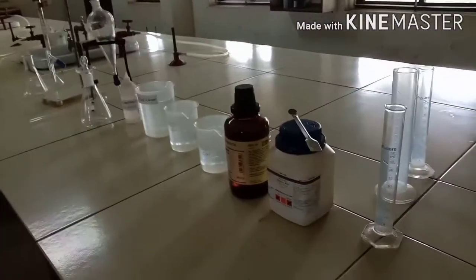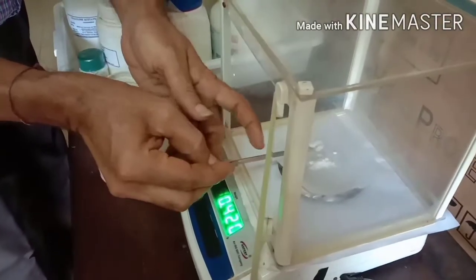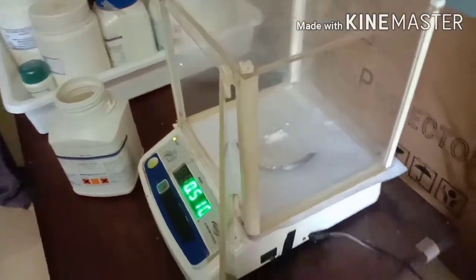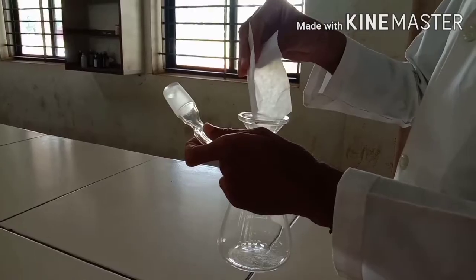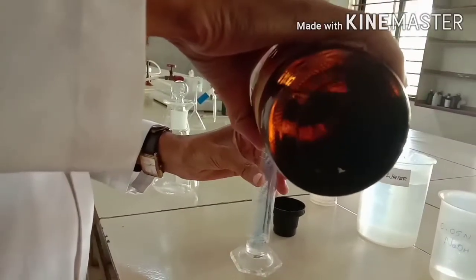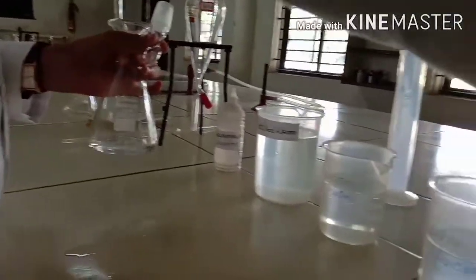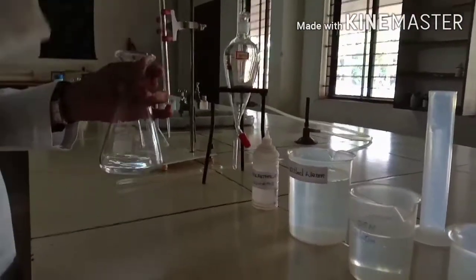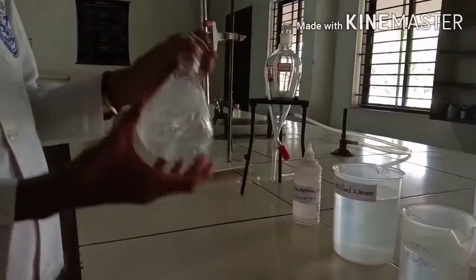First, weigh 500 milligrams of benzoic acid, which is used for set one experiment. Transfer these to a stoppered iodine flask and dissolve in 50 ml of benzene. While transferring, take care. The benzoic acid should be soluble in benzene.